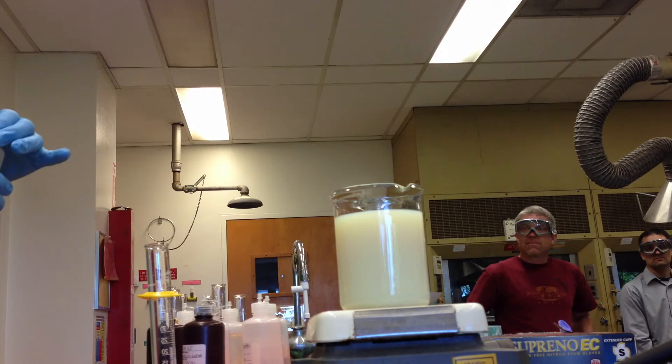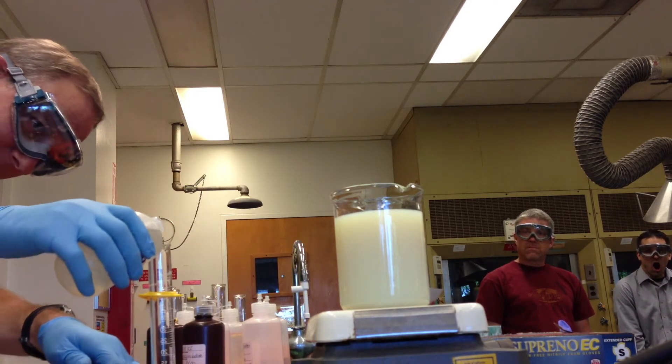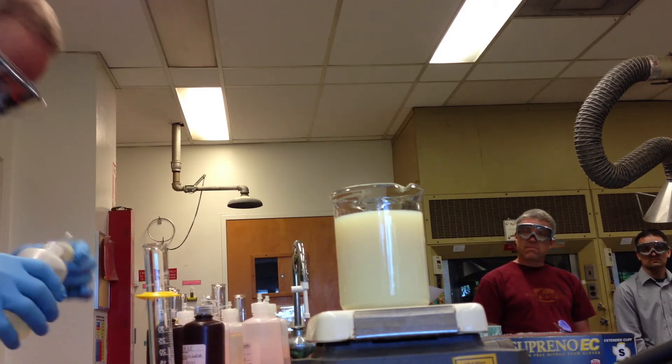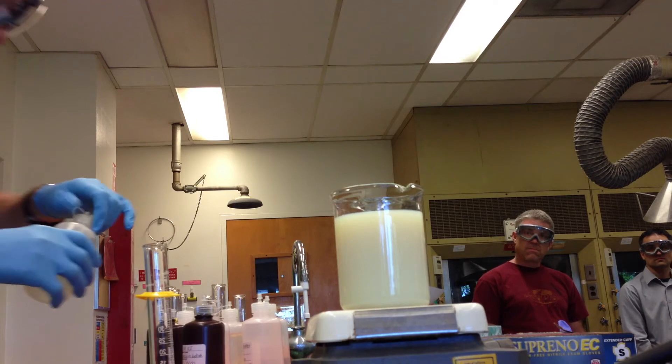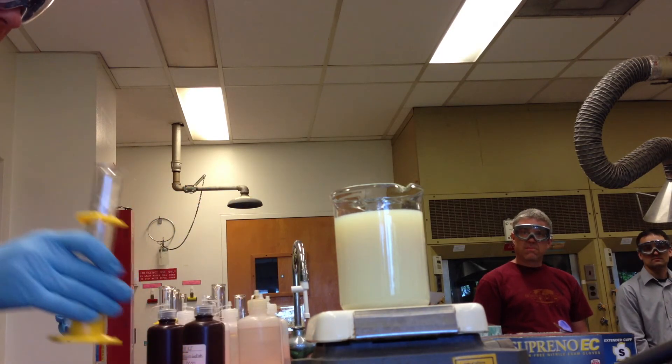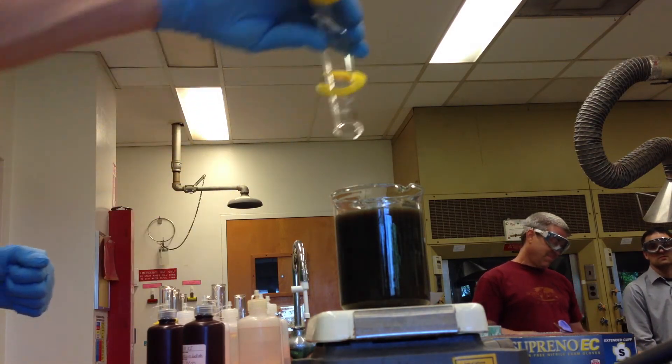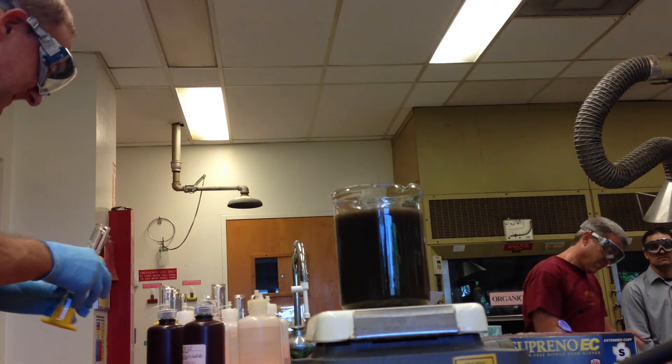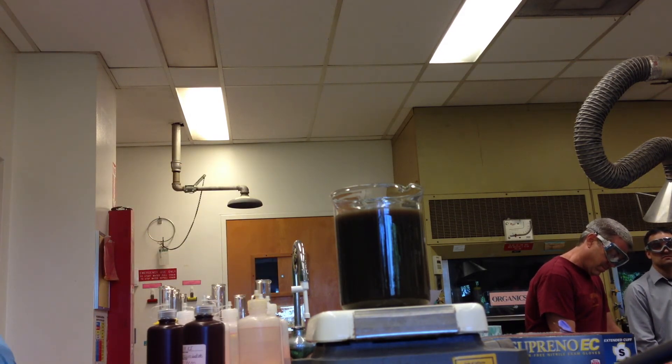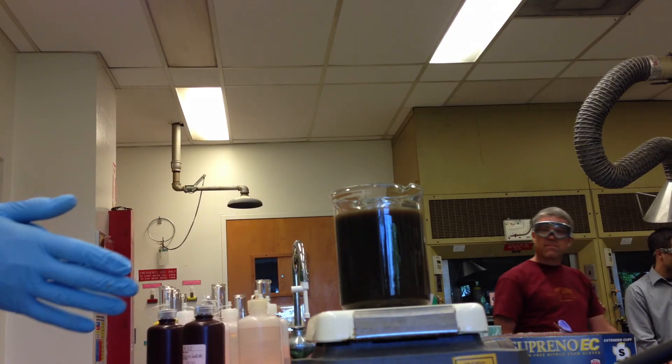10 milliliters of one molar sodium sulfide. So if you want the smell, come on up and smell. What are we going to get here? Silver sulfide. Silver sulfide. What color? Black. It's really that chocolatey brown. I love it. There we go.